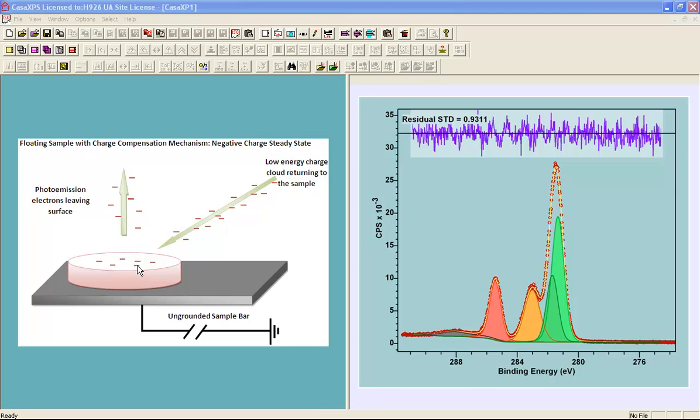When performing charge compensation for a sample, the two important characteristics are that the charge state is stable, that any perturbation to the system does not result in a movement in this charge state, and secondly, that this charge distribution is uniform. Now, it is possible to have a stable state which is non-uniform, and this can cause problems in terms of peak widths and shapes that we see within the data that could be interpreted as chemical state, when in reality it's a peak that has been moved as a consequence of a different charge state across the sample surface.